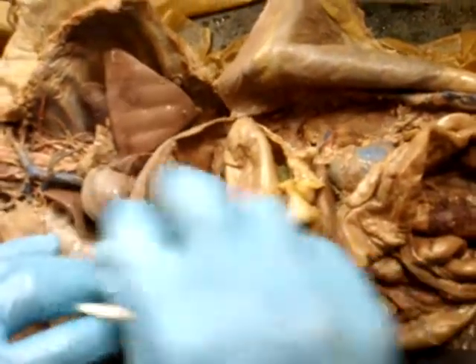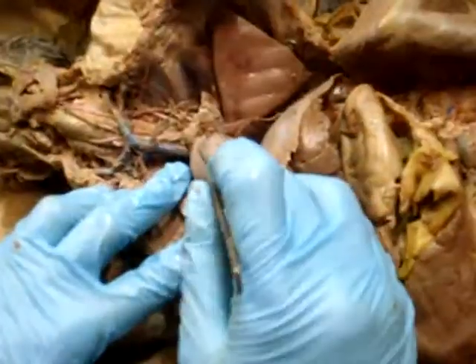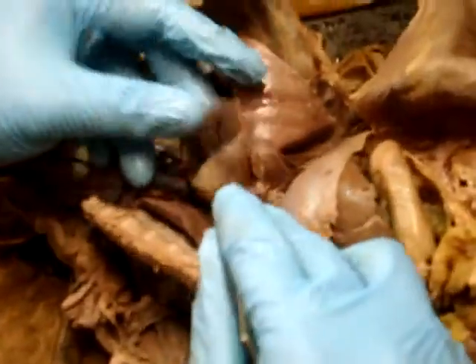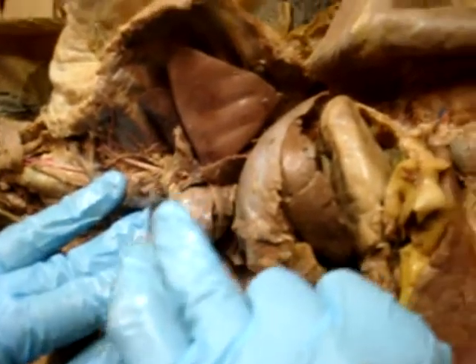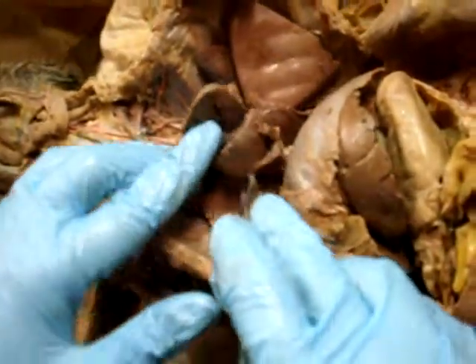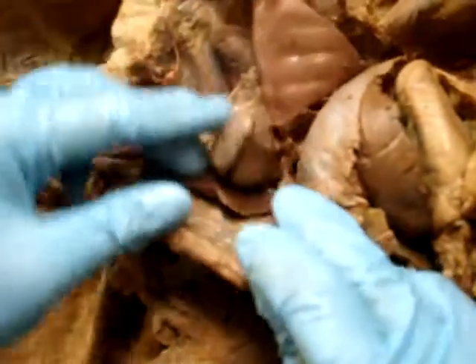Coronary, you have crossed out. Well, I have it crossed out there in the cat. You can see the coronary veins, because usually they don't inject properly. Like here, you see coronary veins, but we don't see the arteries very well. But you have to know them, of course, from the models. That one's really easy to see on the models. Here you can only see the veins, but the arteries are supposed to be injected too. A lot of times on the cats, they don't get injected properly.